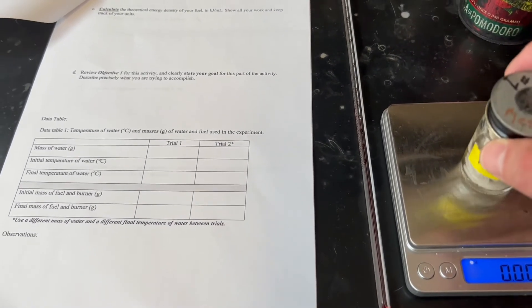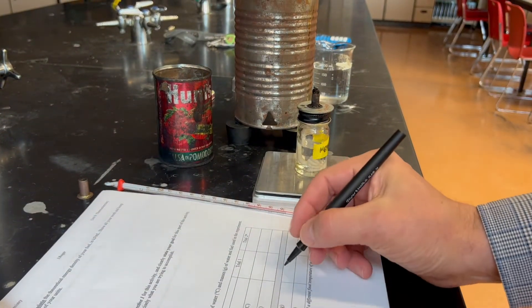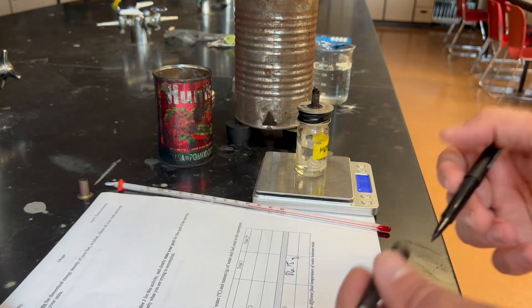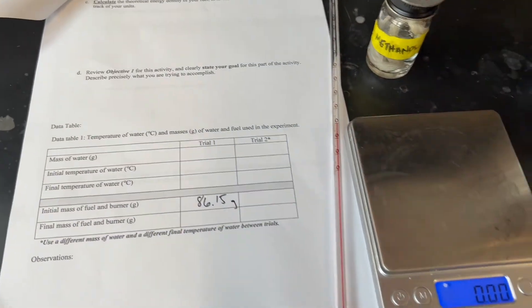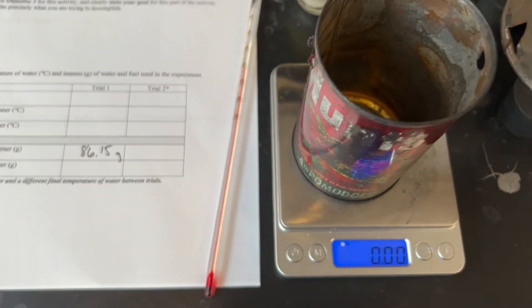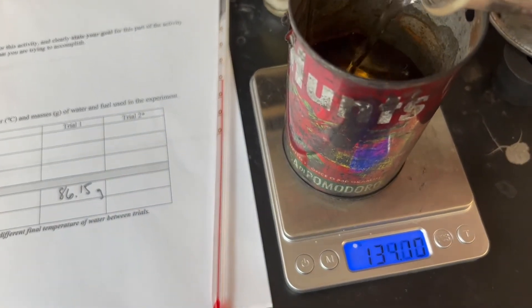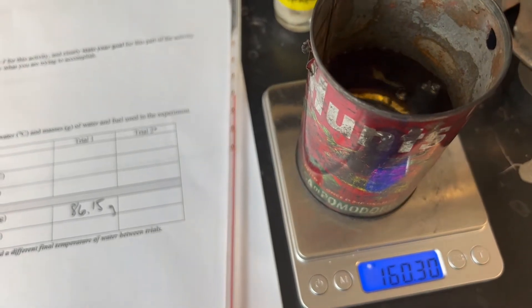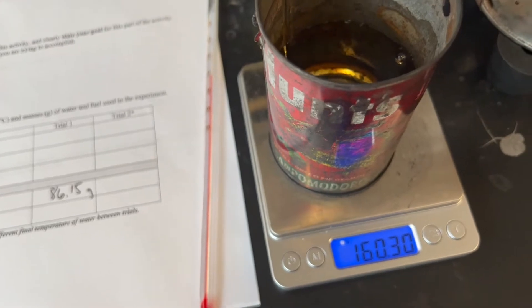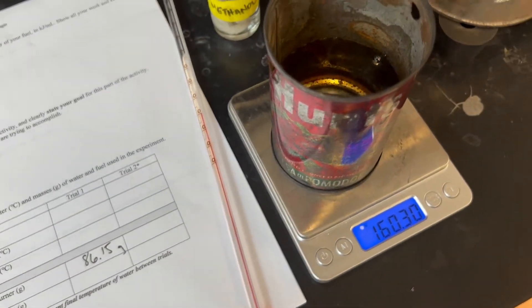First, we measure the mass of the burner before the experiment: 86.15 grams. Then we measure the mass of the water we're going to use. We're shooting for somewhere between 150 and 200 grams, and we get 160.30 grams. The can was zeroed out, so this is the mass of the water only.